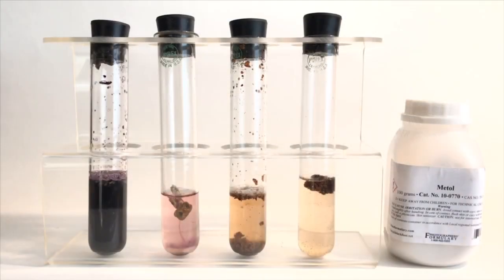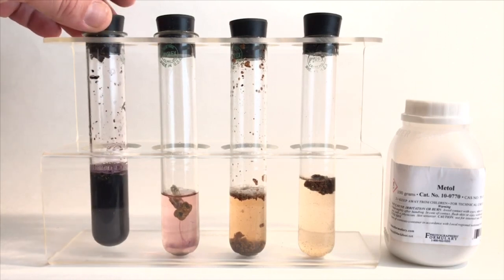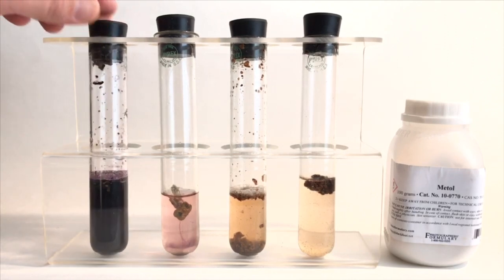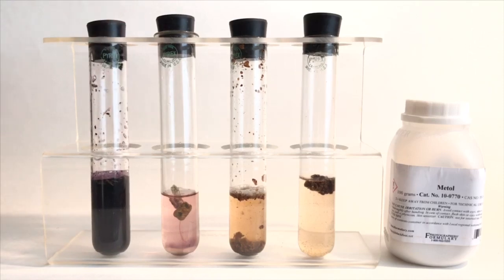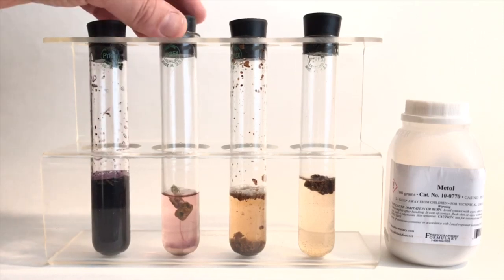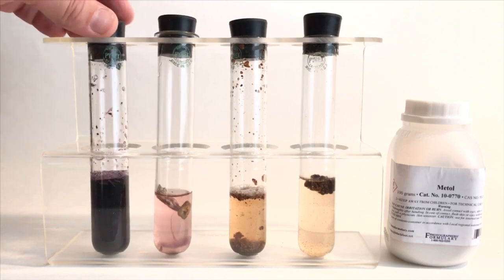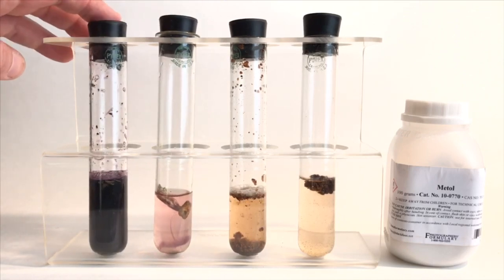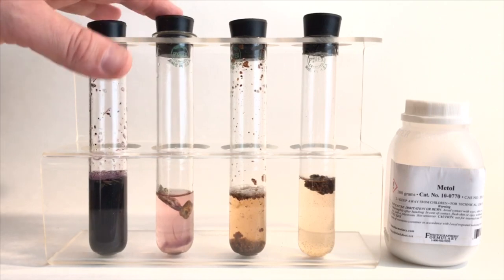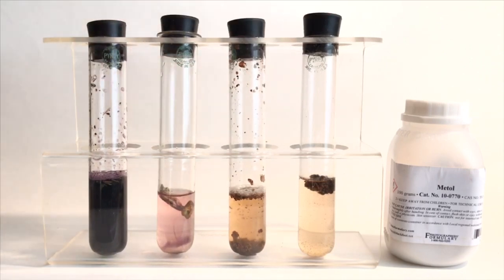So we've given it about 10 minutes here and you can see that the metol test is working and that I was correct. A couple little mushrooms that I grabbed from the neighbor's lawn do in fact contain psilocybin or psilocin. And you can see that the test works a lot better. So here I have some of the mushroom that I ground up and then this is the whole mushroom, this is the ground up mushroom and the whole mushroom.